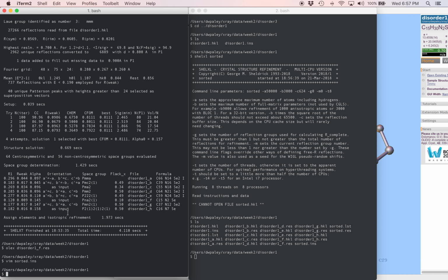Look at the orientation of these solutions. Some are as input, and that means that the A, B, and C axes are whatever the diffractometer originally decided they were. Some of them have their axes mixed up, and that's because these space groups have a conventional setting. For example, if you kept the original setting of this solution, 1D, this would be in P2MM. That's not a space group, not for any logical reason, but just because the space group is called PMM2. So the axes get reset sometimes just to follow convention.